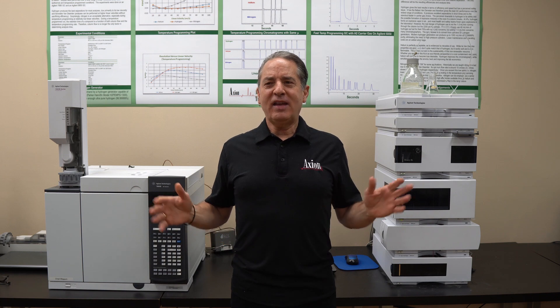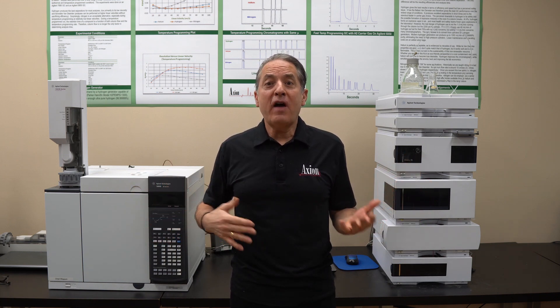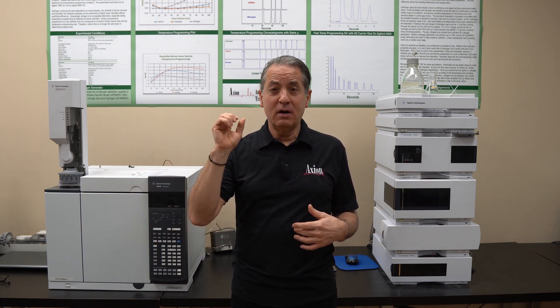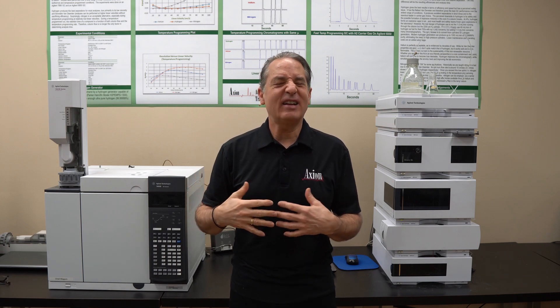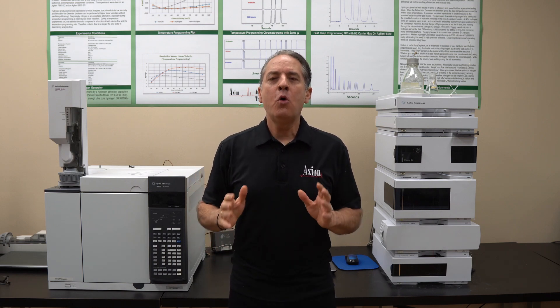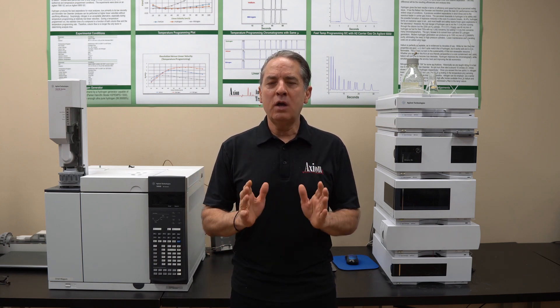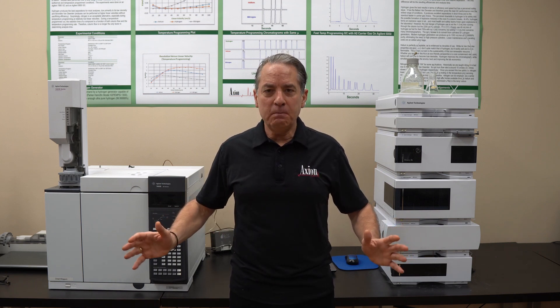I like a nice 30-meter column, 0.25 millimeter diameter, 0.25 micron film thickness. That's not that important — what I'm getting at is you're going to choose one good generic, very long column.